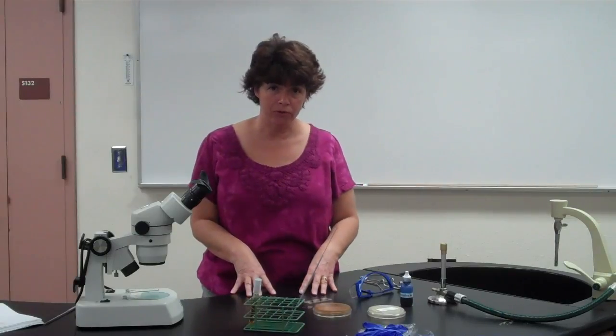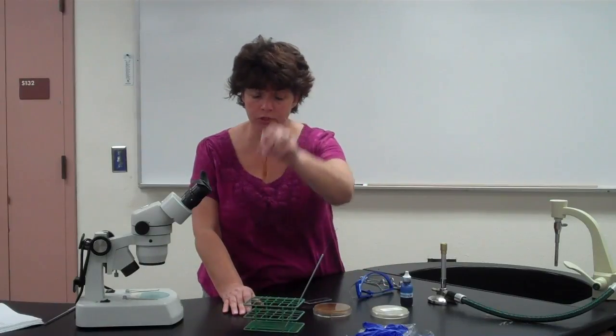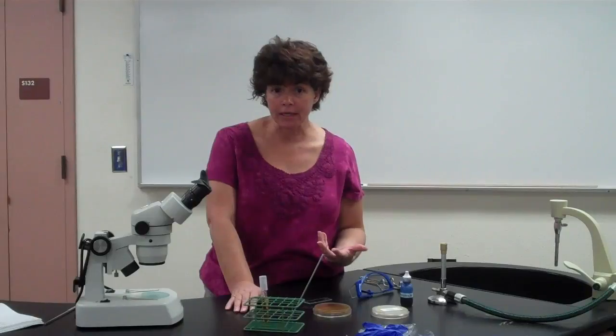These also take a while to grow, so they're going to be a week before you look at them a second time. Like I said, you'll be given a plate with them, but also a tube with the particular fungi. Now remember, they're going to be numbered, and it says 1 per student. With some of the smaller classes, we might have 2 per student so that we are able to look at all of them. So basically your goal is to try to identify it without knowing what it is.